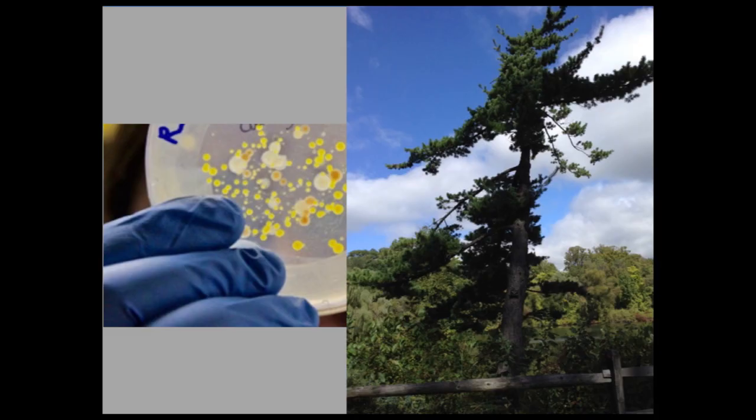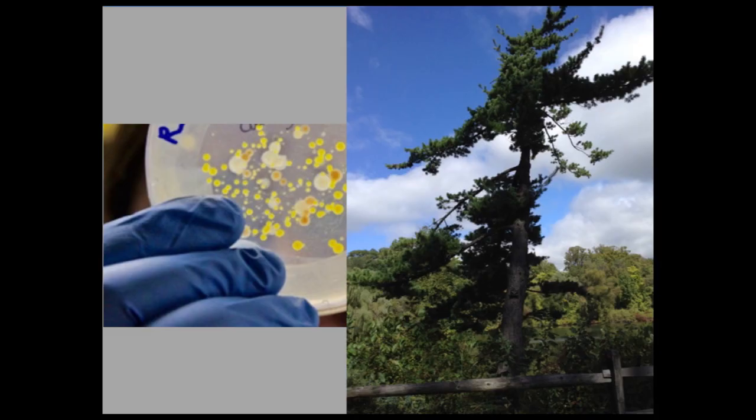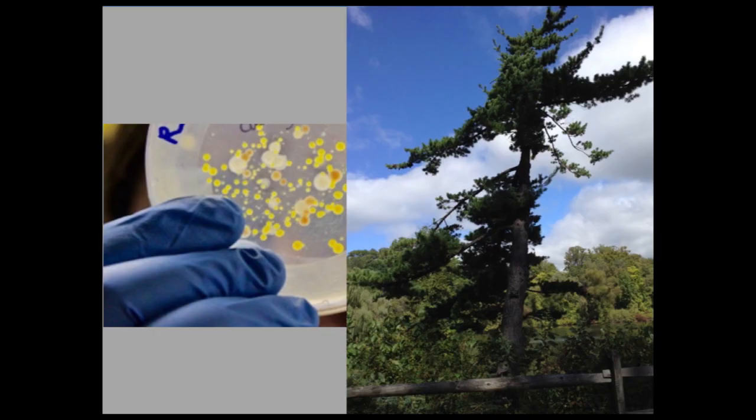What is this particular strain of bacteria, isolate F10, that is recorded as having yellow colonies? An undergraduate class at Haverford College in Pennsylvania, USA isolated it from a Japanese white pine tree.